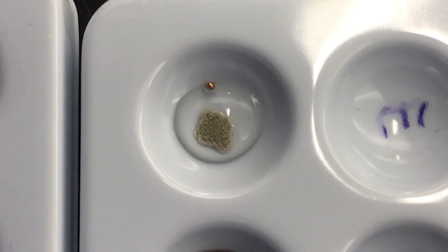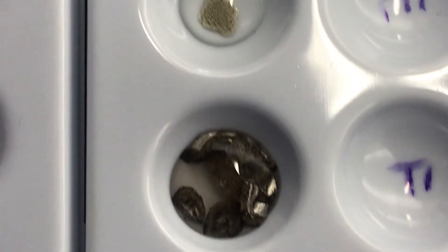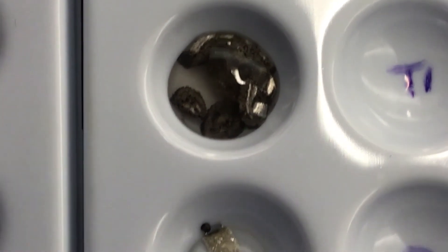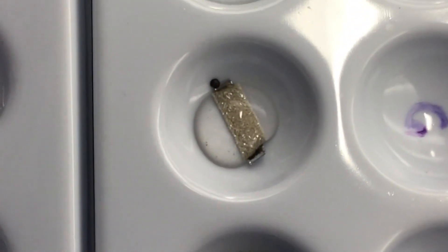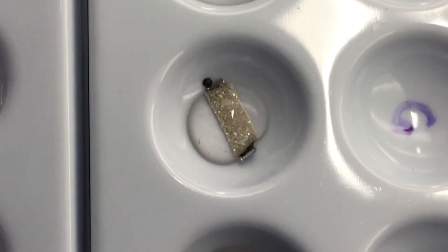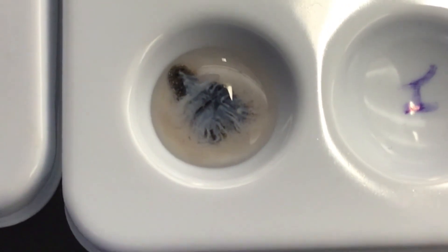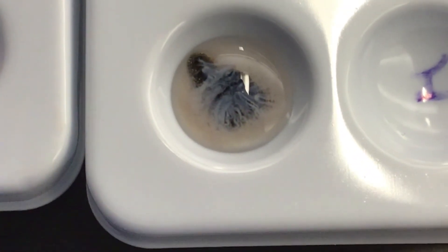We got silver solid forming, and now the copper is in the liquid with the nitrate. Magnesium is now in the liquid with the nitrate and silver is building on the surface. This one's really cool — you can see crystals of silver forming, and the liquid is now zinc and nitrate. And look at this — we've got a white cloudy liquid because now we have tin with the nitrate and the silver is by itself.